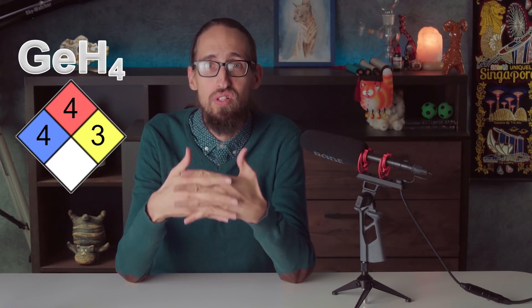Hey guys! I just finished making footage about germane, where the main precursor was germanium tetrachloride. Before I upload it to the channel in a few days, I'd like to show you a couple of reactions with germanium tetrachloride.